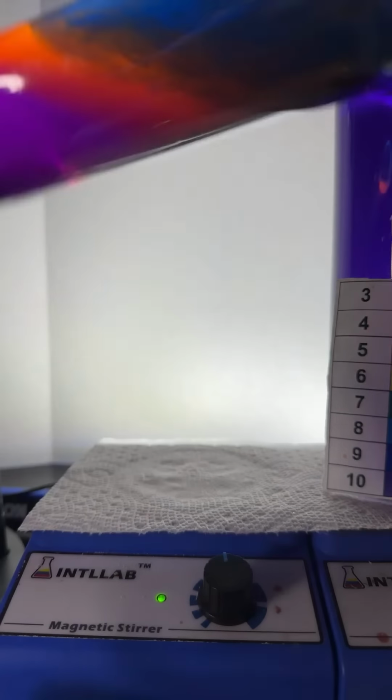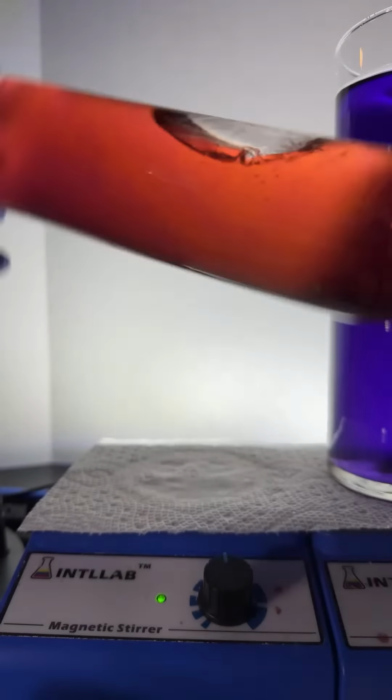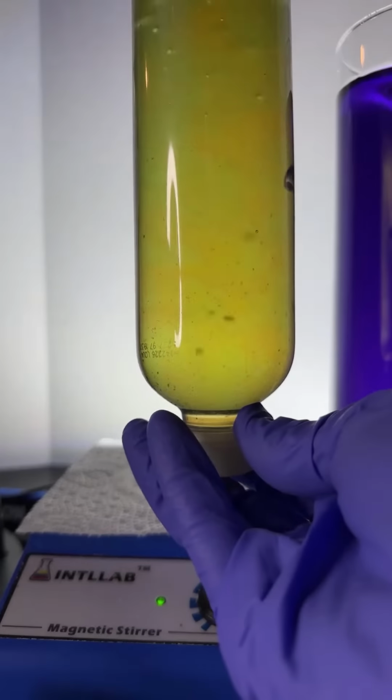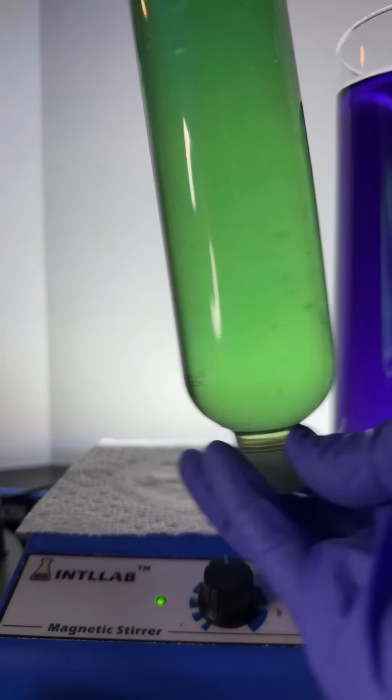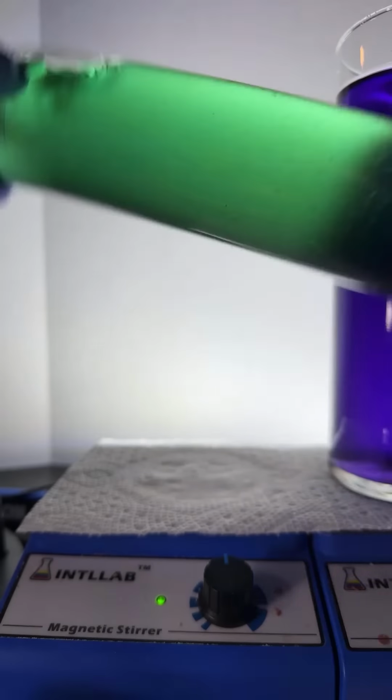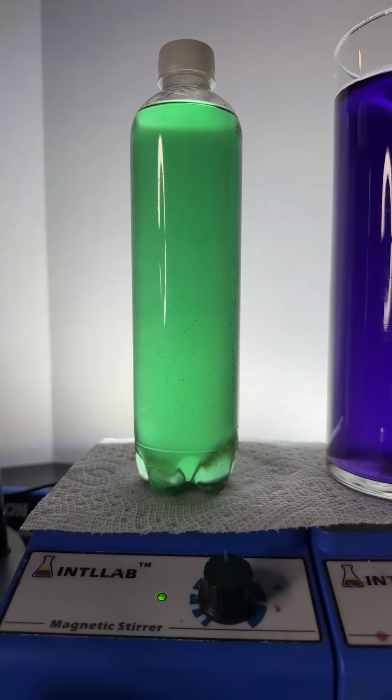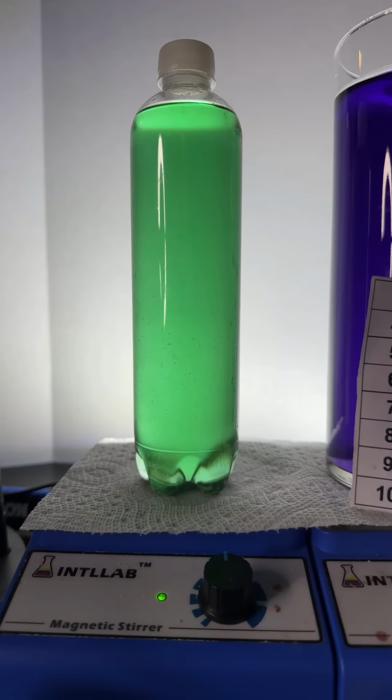Acetaminophen reacts with iron ions to make a blue-colored solution. Let's shake this up. Let's see what happens. It looks like everything's going to go red, but wait a minute. It looks like the base might be taking over. What's going on? Maybe I perfectly balanced it and we're going to end up at neutral. I don't know. Let's just see. That's really interesting how there's like a shifting going on there.